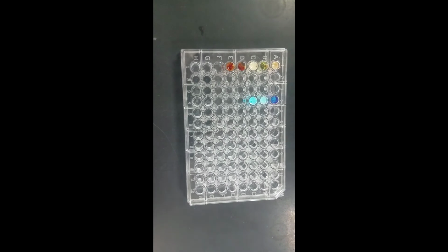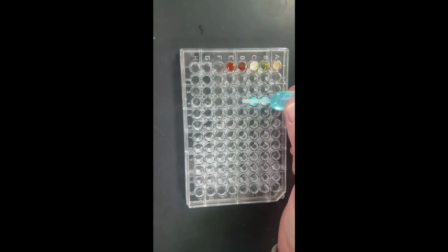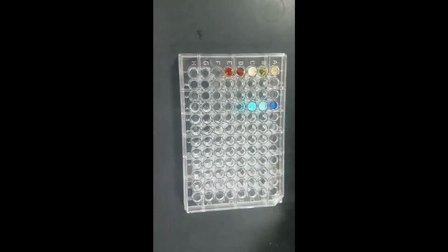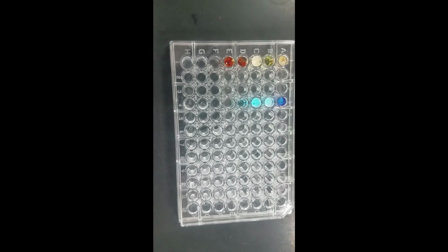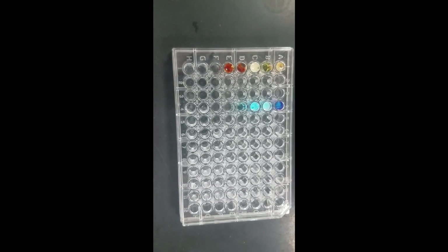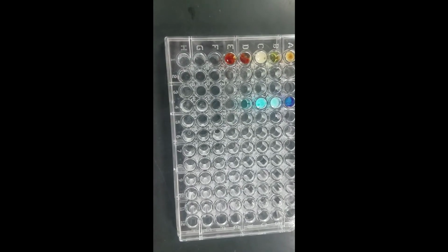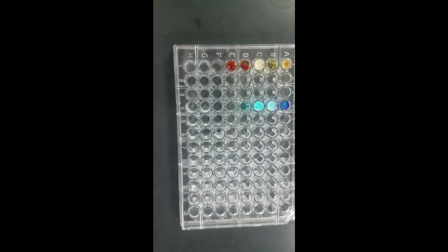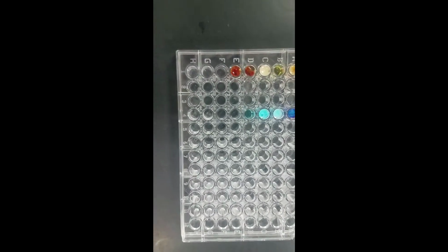Number 9 experiment. Again, we're going to use copper sulfate, 2 drops, and now I'm going to use hydrochloric acid. Go find it. We have these already set up. It doesn't look like anything changed on that one. There's no precipitate, no real color change, so there's no evidence of a change.